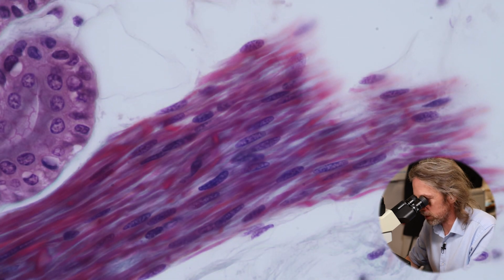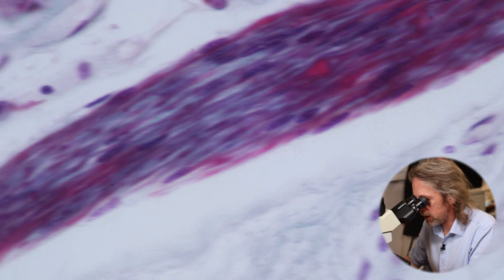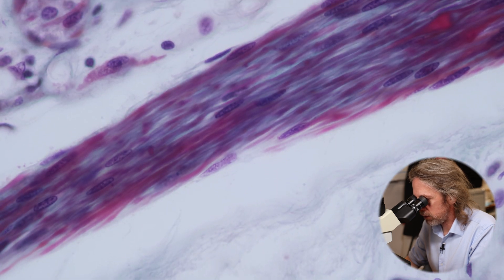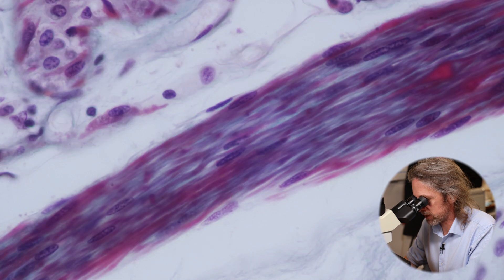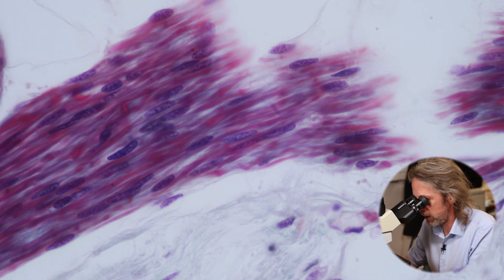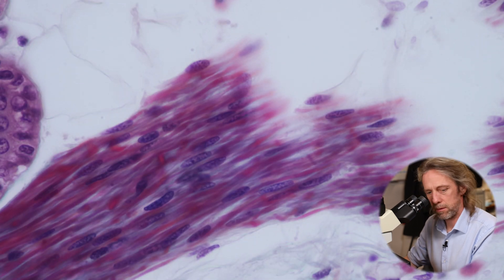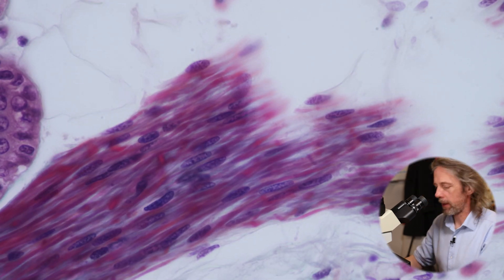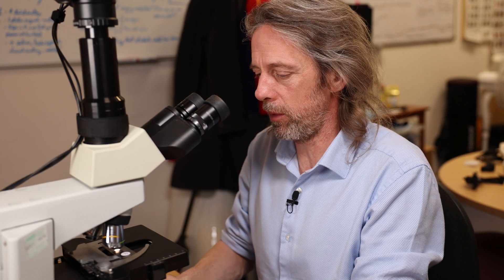We've only got so many tissues in the body. If we're looking at muscle and trying to work out what type it is, that's what smooth muscle looks like - it just doesn't quite look like cardiac or skeletal muscle. That has rounded out our look at muscle.